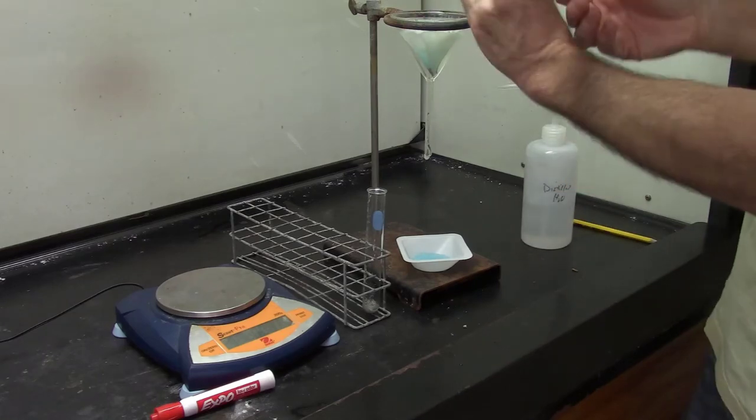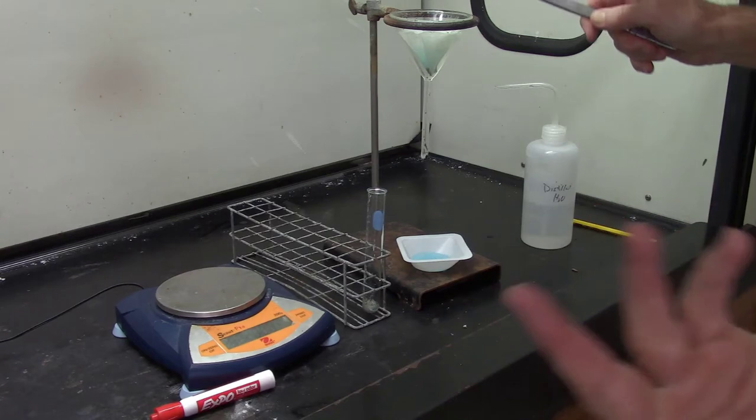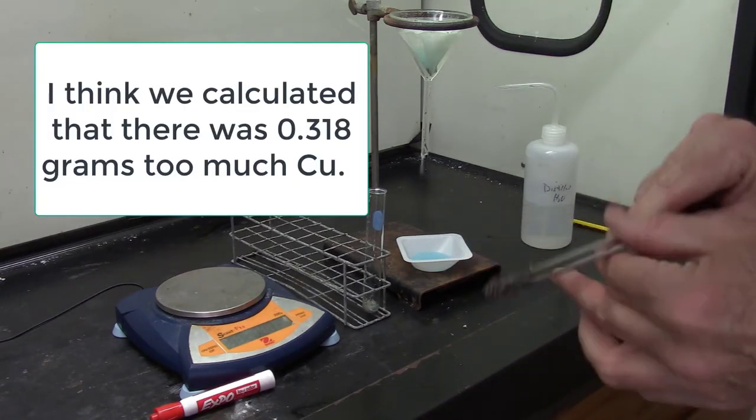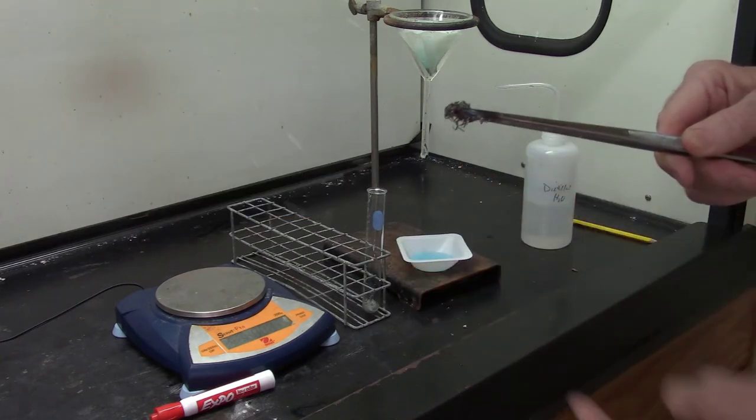Hey, you know what I can do right now? I can dry this copper and see how much I have left. That's a pretty common question. How much copper did not react? So we know we have excess copper. How much excess is there?